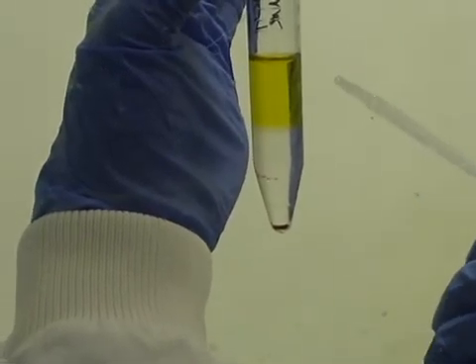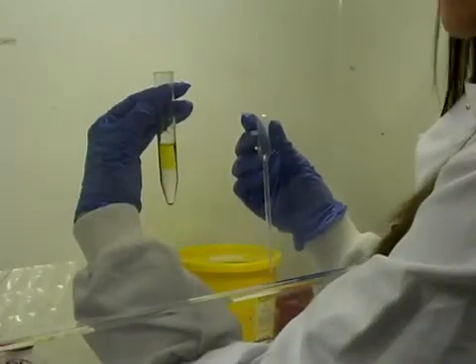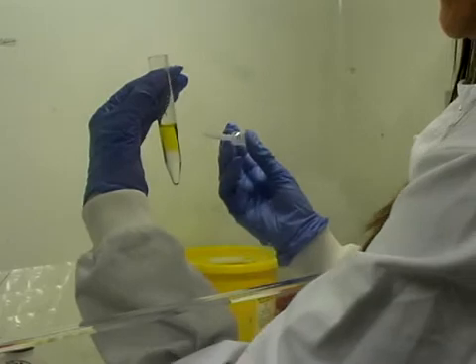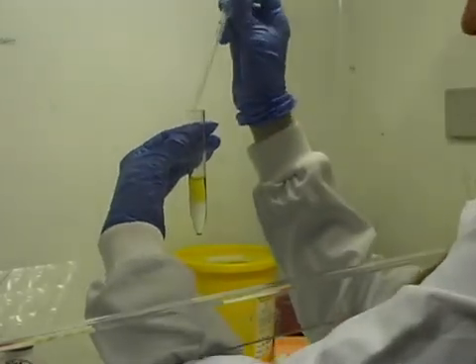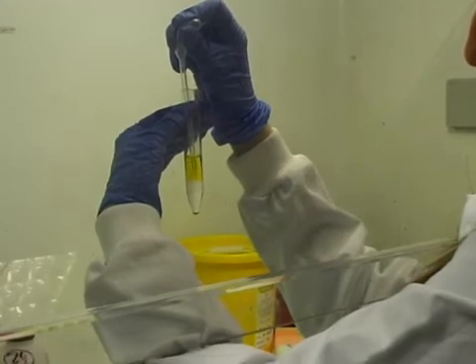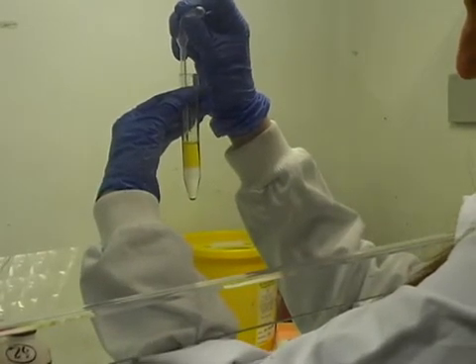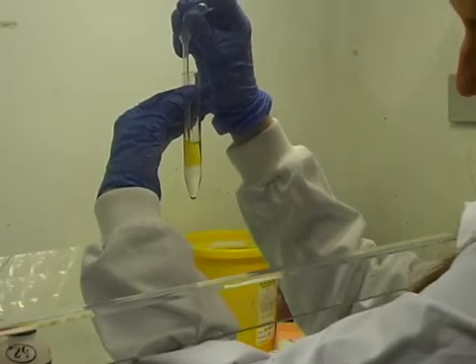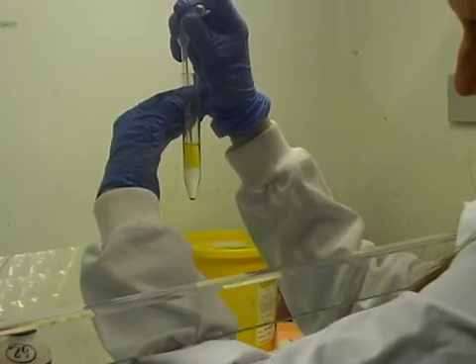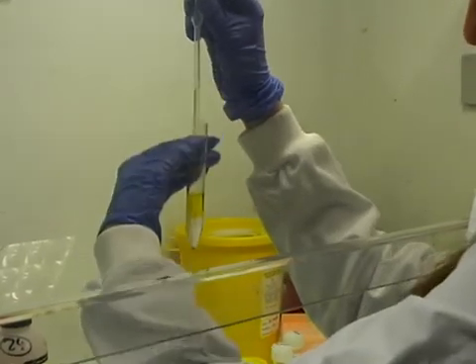We then have to sample those cells to put them on the slide to screen them. To extract the layer of cells in the middle, you have to place a pipette down through the middle of the sample and try and collect that buffy clear layer just underneath the yellow part, circling all around to try and get as much as possible.